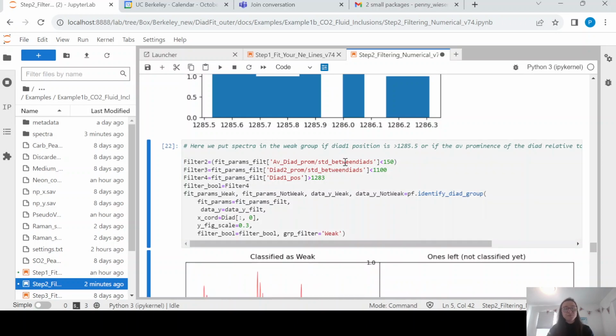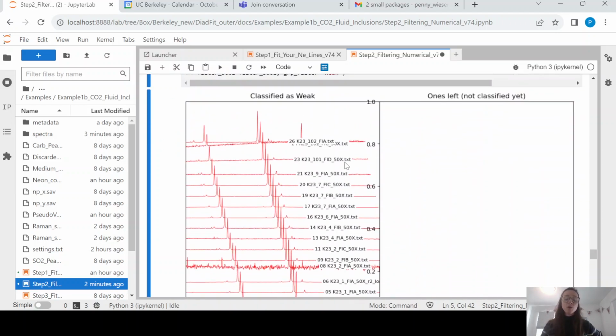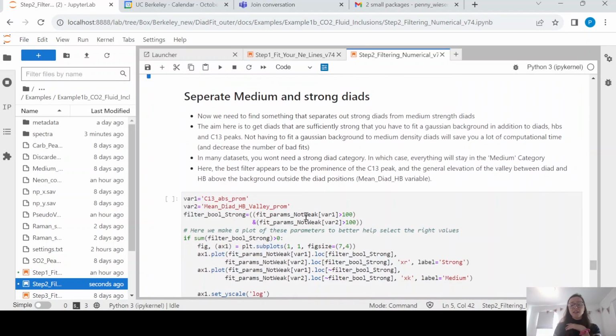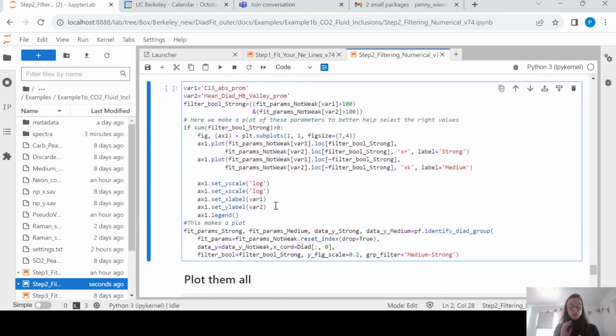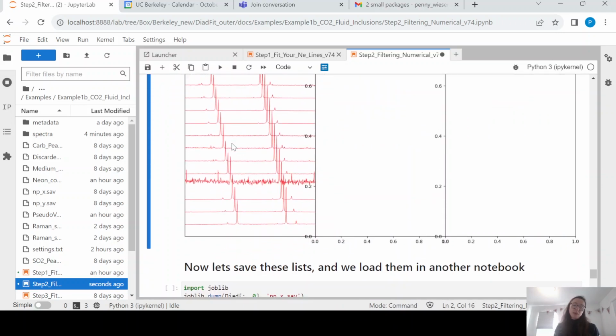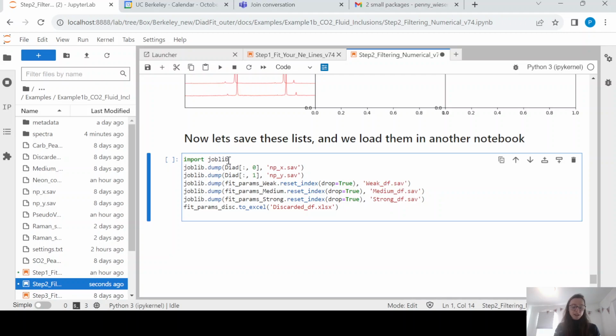Here there isn't. Okay, so we're going to classify all of these spectra as weak. None of them have hot bands which are significant enough and raised up enough that we're going to need that Gaussian. It's not a big deal. Okay, if you had weak, medium and strong, you would want to add some filters in here so that you are comfortable that your medium ones and your strong ones are different, but not a problem here. We're then going to plot the group. So we see all of ours are weak in this example. And then finally, we're going to save that list. And that is step 2 done.